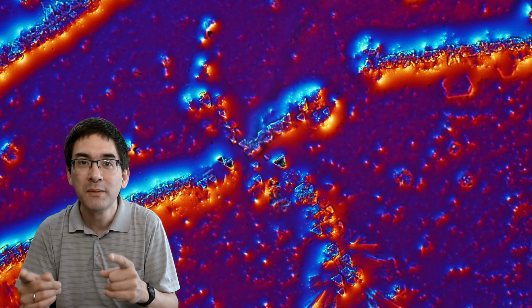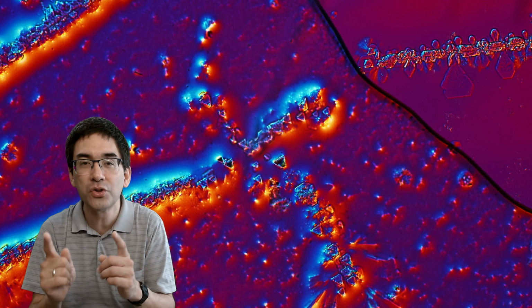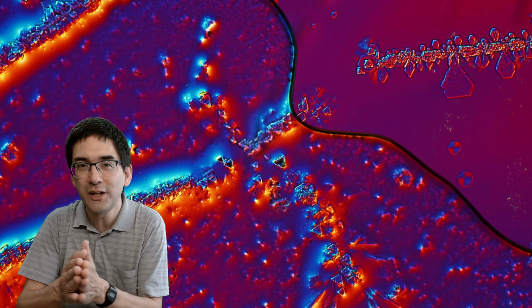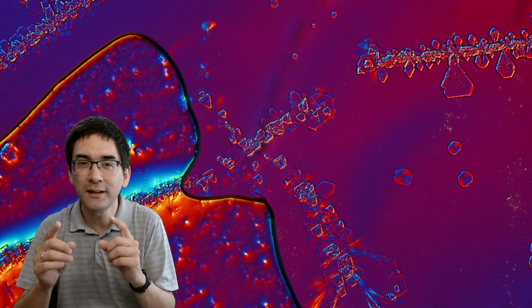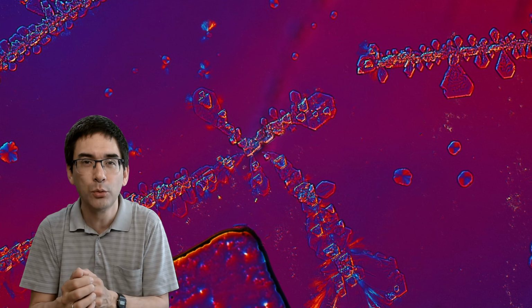Did you see that? This was water, and the crystals are gone now because they dissolved again in water. However, on the other edge of my cover glass, I was also able to do this, and look how the water passes and the crystals do not dissolve. Why is this? Look in the corner, the crystals stay there. The reason is that by the time the water has reached the other edge of the cover glass, it already became saturated, and therefore it did not dissolve the crystals anymore. I think this is a very nice way, because the crystals become more visible and more distinct, and it simply looks a little bit more beautiful.